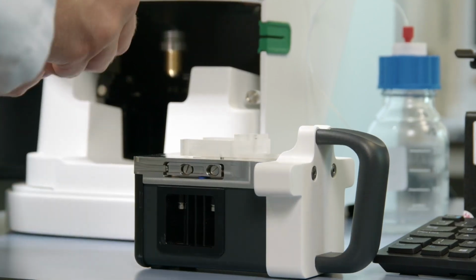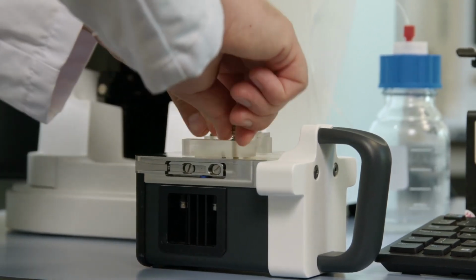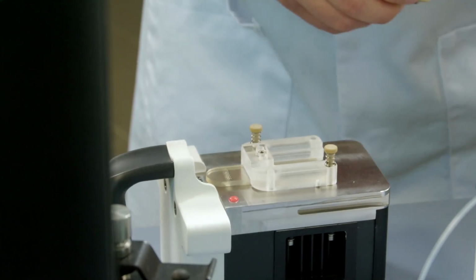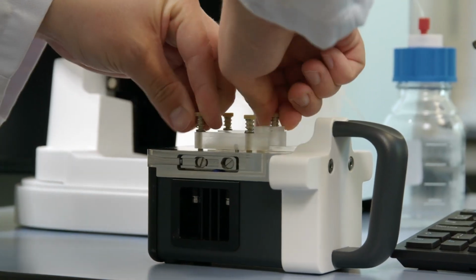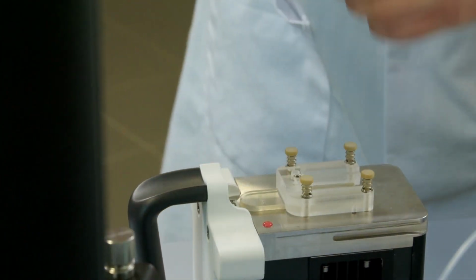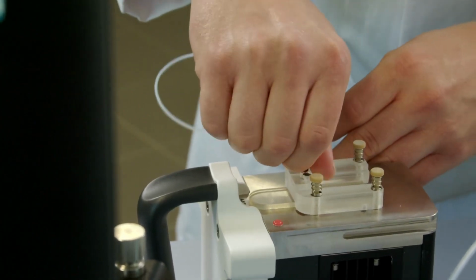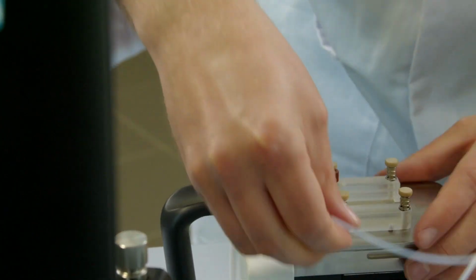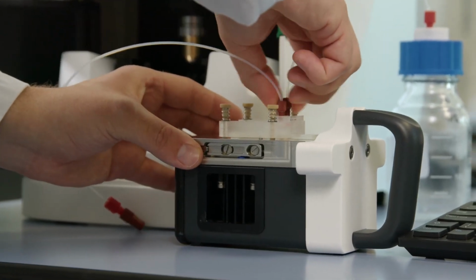Then we've got our screws as well, can be held in the instrument. We just screw these in, secure the flow cell to the laser module. So it's 2 in each opposite corner. And then once we've got our screws in, we can now put in the inlet tube for which the sample will go into the measurement window through. And then finally, our outlet tube for which the waste will go out through.